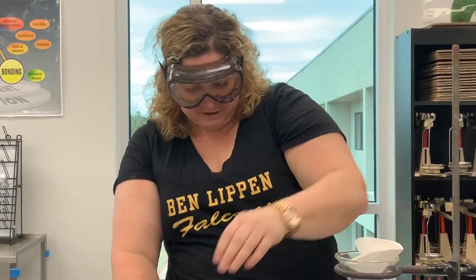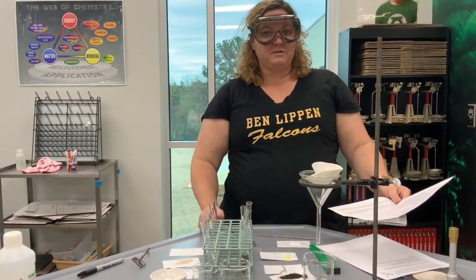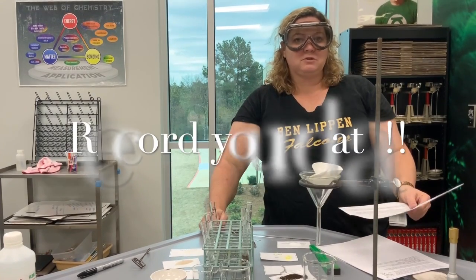So very clear. All right, so we need to take a moment and record those findings of what dissolved and what did not dissolve, and discuss whether this is a physical or chemical change you're seeing.